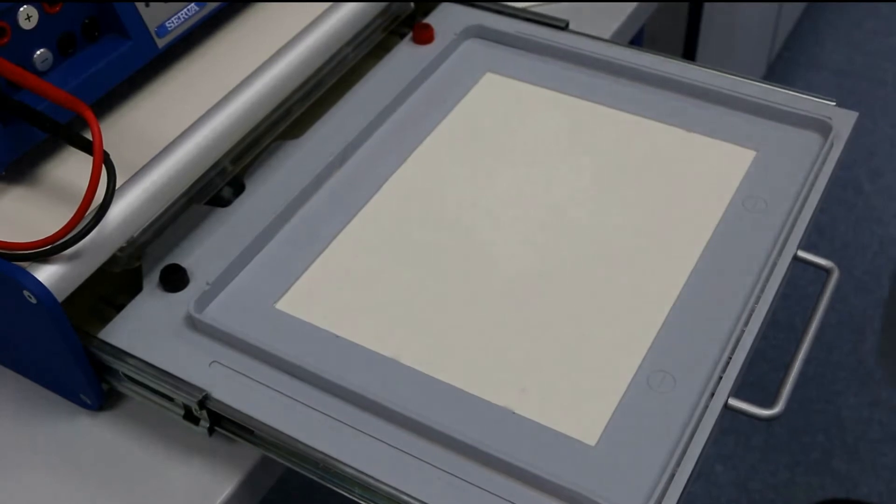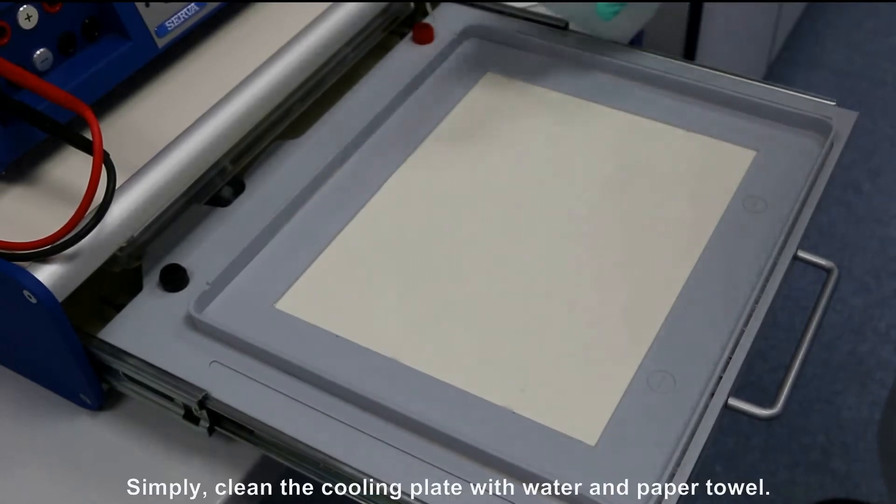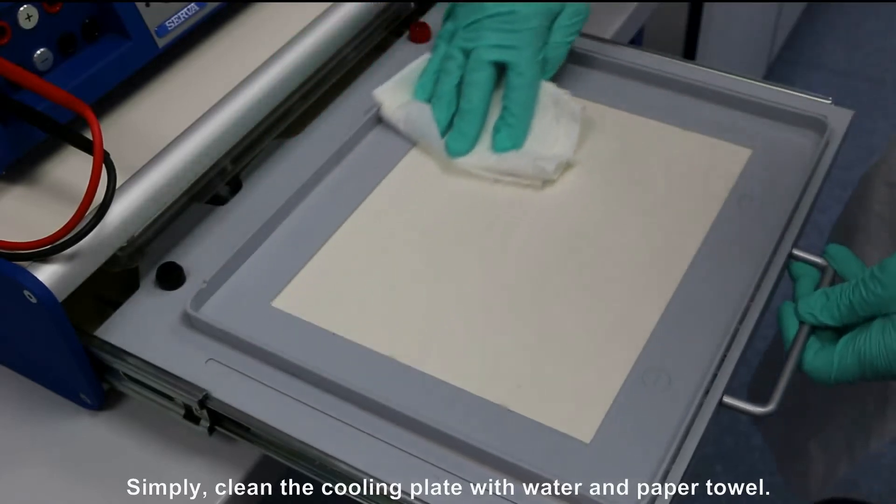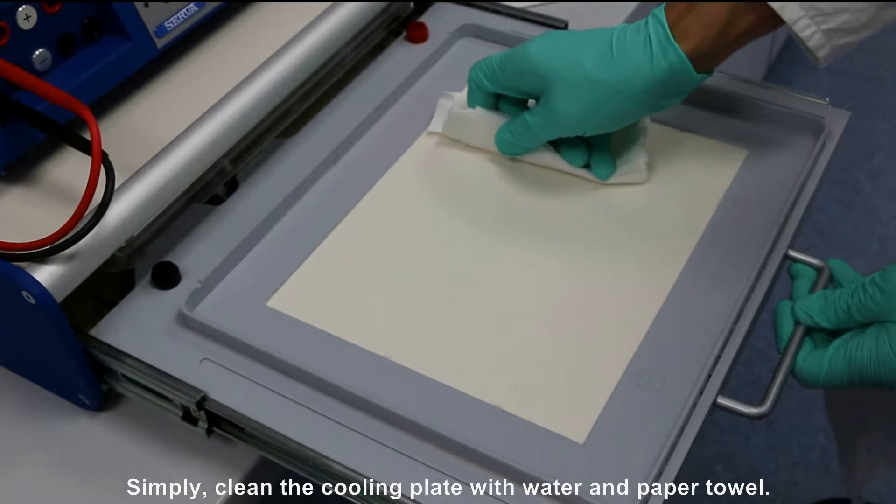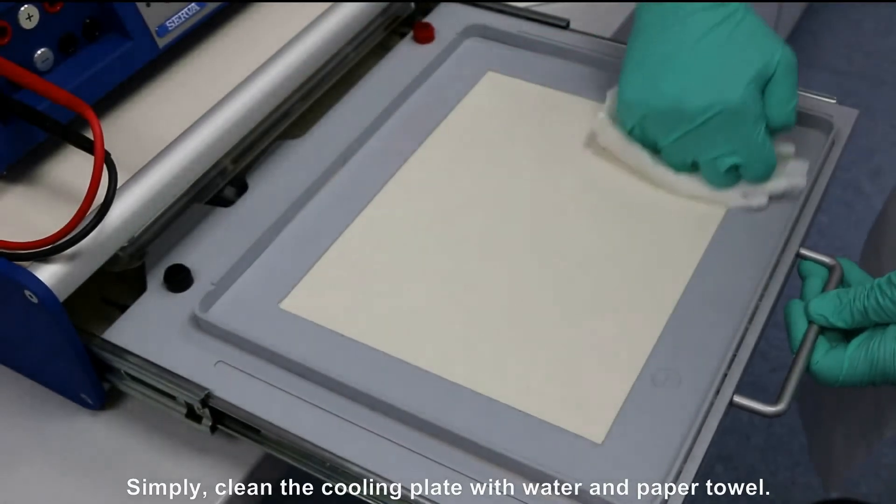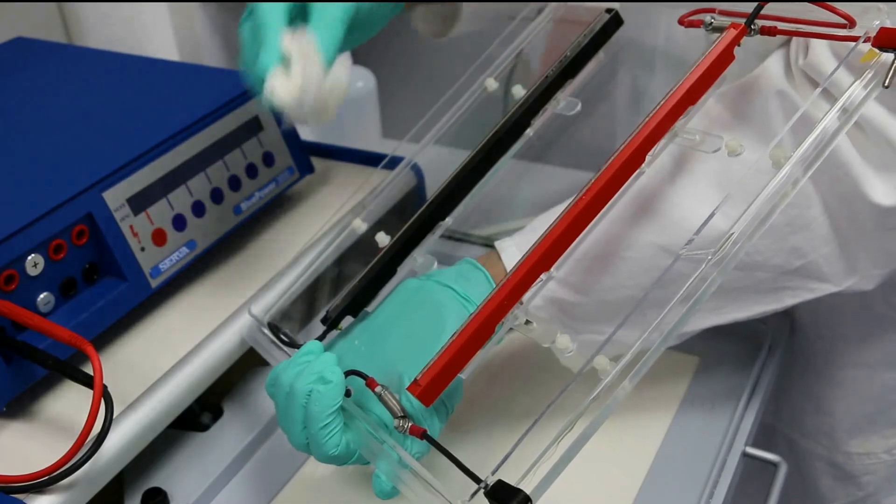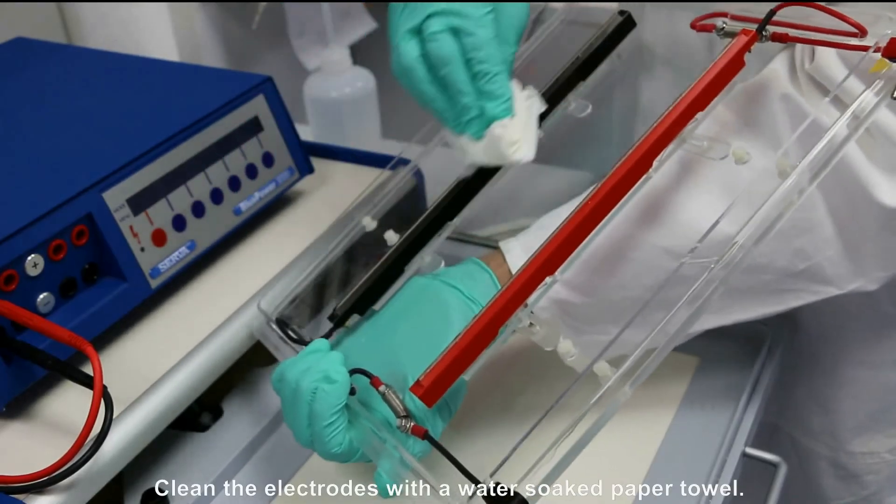Meanwhile, easily clean the cooling plate with water and a paper towel. Clean the electrodes with a water-soaked towel.